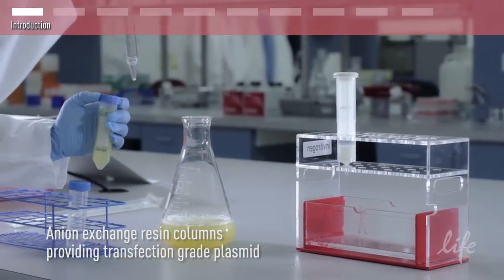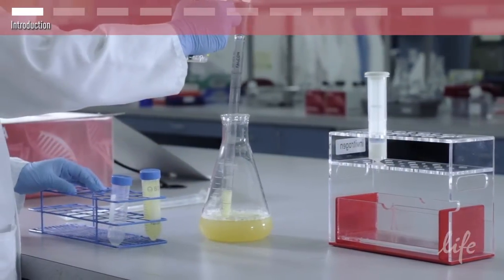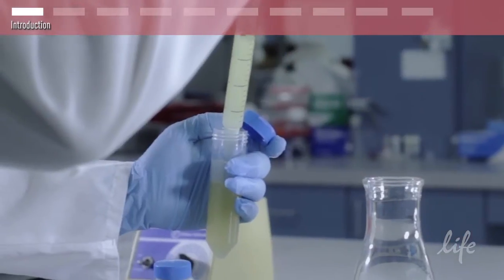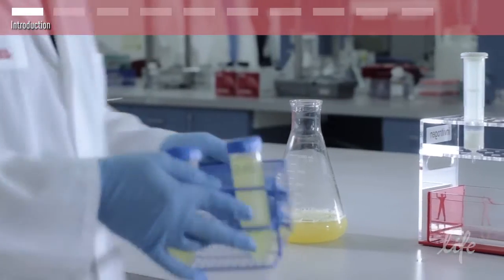We have chosen this kit because it is a gravity flow system that allows you to process multiple samples at the same time with fewer tedious hands-on steps than using a traditional plunger technique or centrifugation.